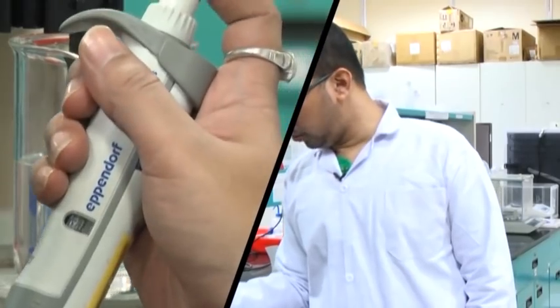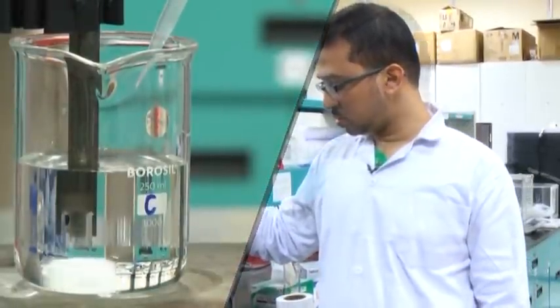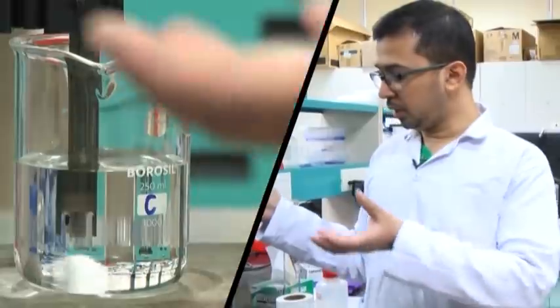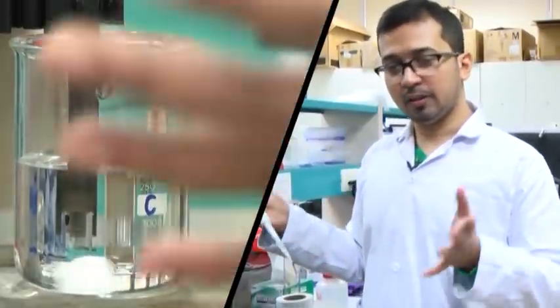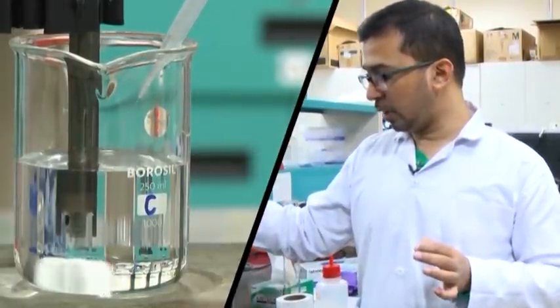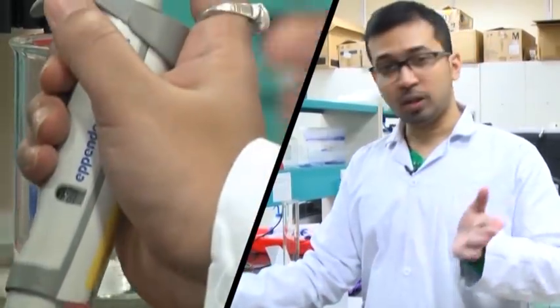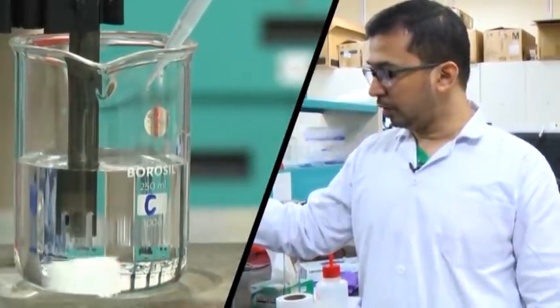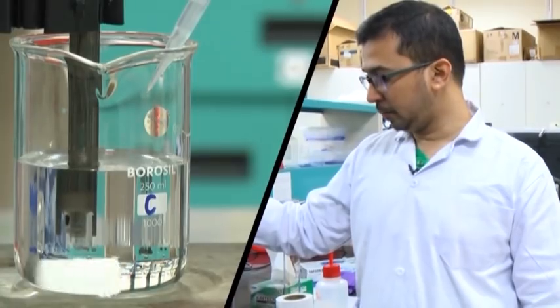It has reached 7.74, and our aim is pH 7.4. Whatever happens, please do not in a hurry pour bulk solution into the dibasic in the buffer region. One might get impatient and add a large volume, but do not do that because it will not give you the desired pH. Always add drop-wise; if you add bulk — like 5 ml at once — instead of 7.4 it might go to 7.0 or even down to the range of 6.8.